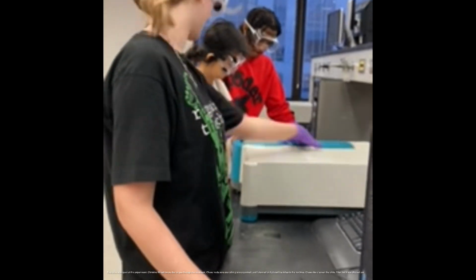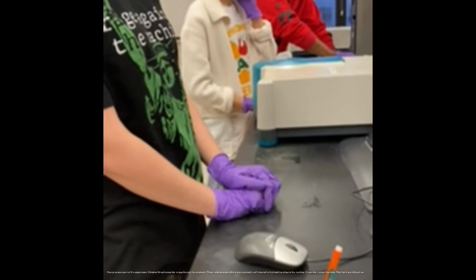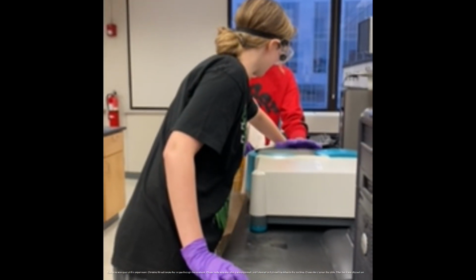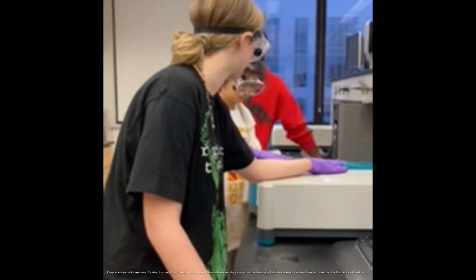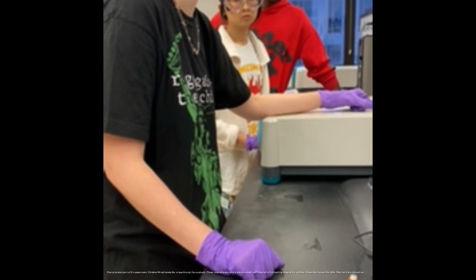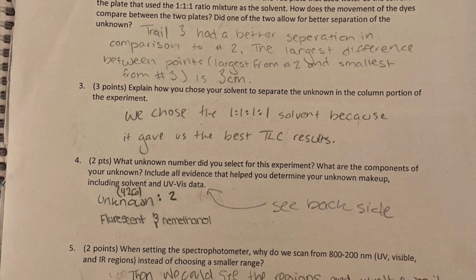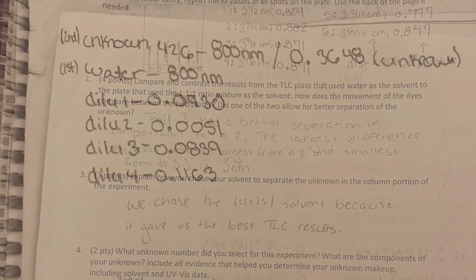I told my lab mates it was basically that the more stuff in a liquid, the more light it soaks up, and they change together like a straight line, like we saw in our graphing program on the spectrometer. It's basically concentration versus absorbance, because the more stuff you add in a liquid, the more light it absorbs, and together they create either a straight line or a curved line, etc., which we'll see is a straight line for us personally.